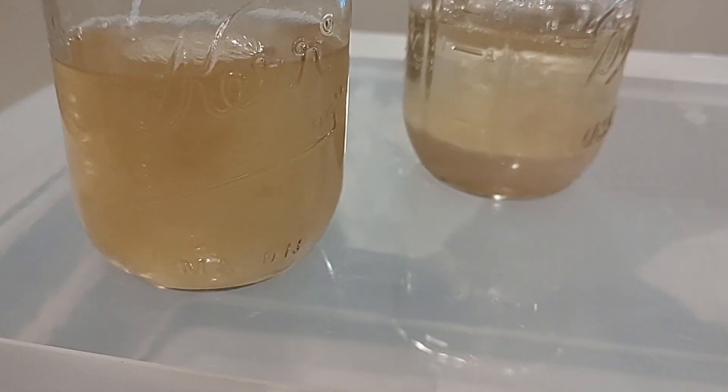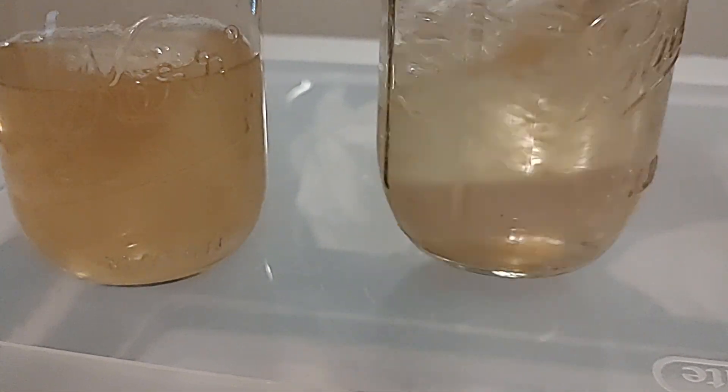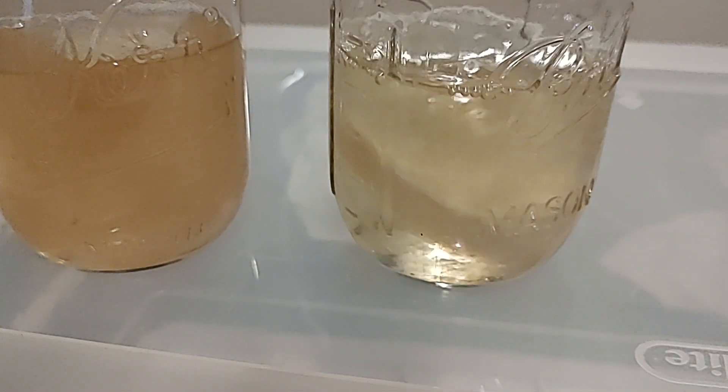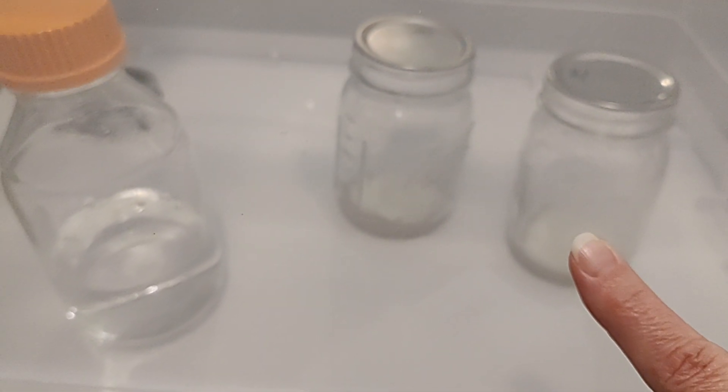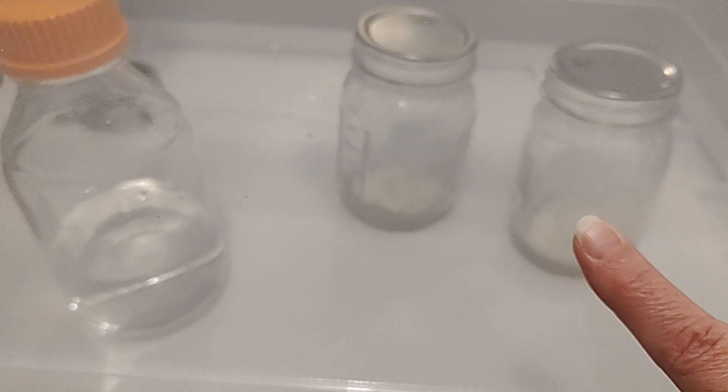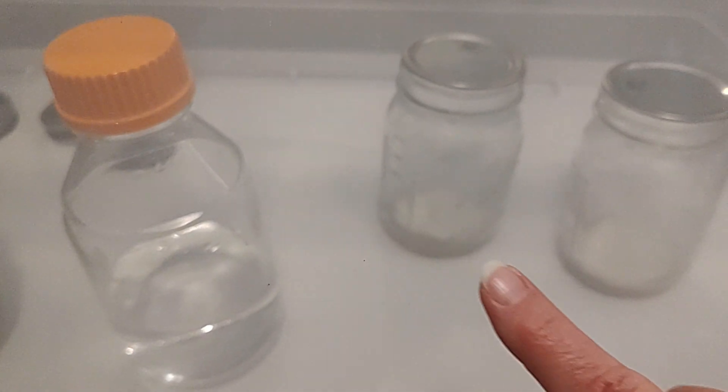Recently we've been talking about these slurries. I'm going to create a video for you where I'm going to show you how you take these giant agar jars. It's just an agar plate down at the bottom there, and you can see the mycelium has grown out to the edge.